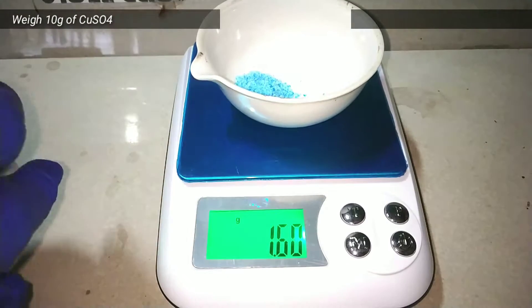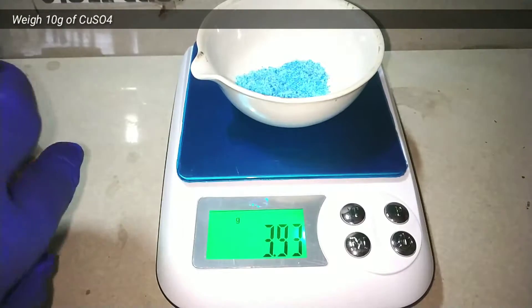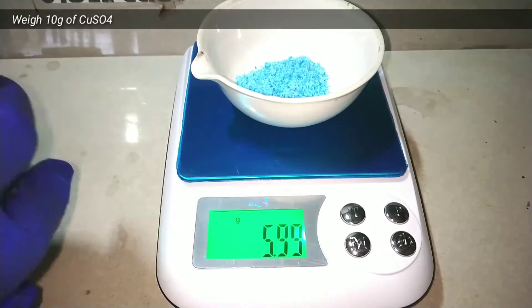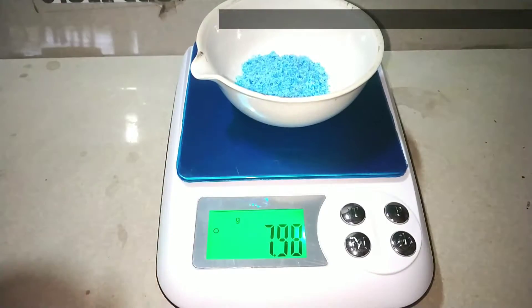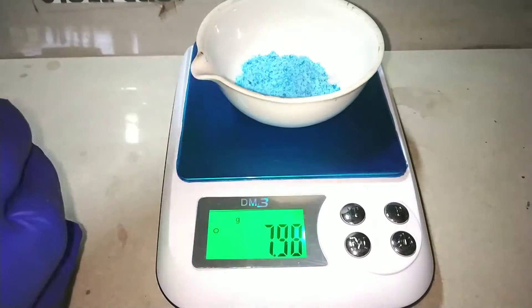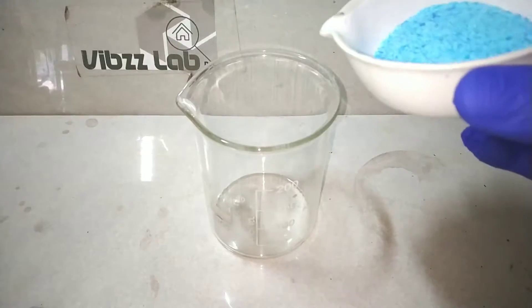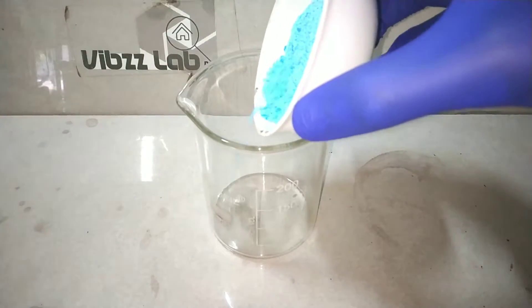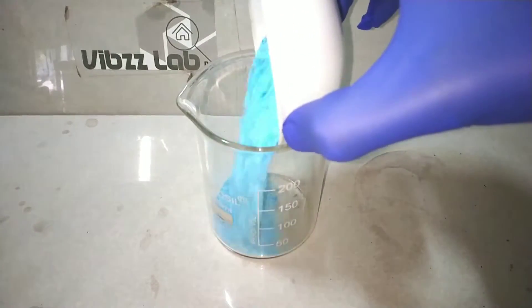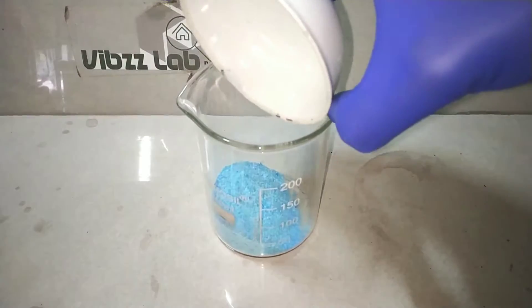We start by weighing out all the reactants. First of all I weigh out 10 g of copper 2 sulphate pentahydrate. Always try using powdered copper 2 sulphate, otherwise you will have a very hard time dissolving the larger crystals.